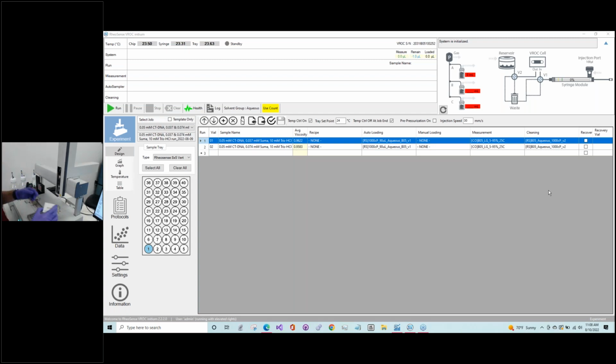Let me see. So our chips do have two lines here. You just want to make sure this clear tubing is completely dry. There might be some other liquid in the tubings that are connected to the chips. That's okay, but you just want to make sure that this clear tubing is nice and dry before you use it. And then after you check that, you want to make sure everything's closed as such. And if everything looks good, then we could start looking at our diagnostics and testing page here.